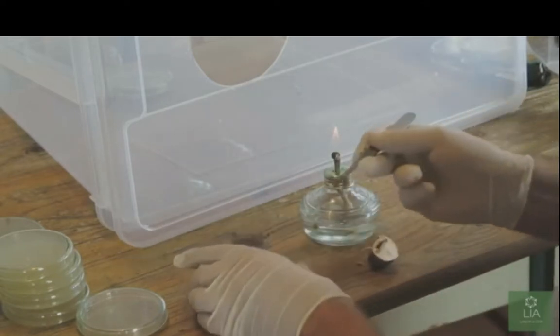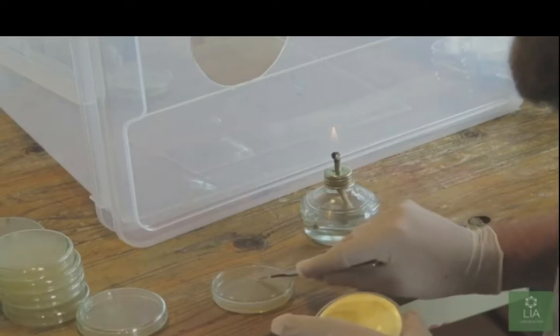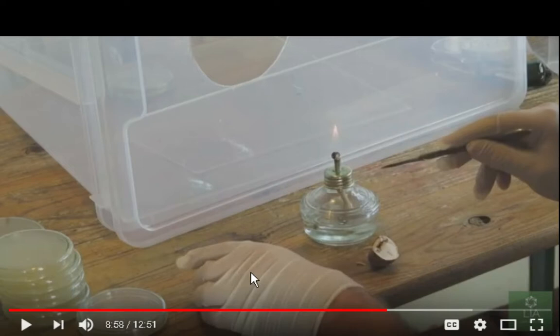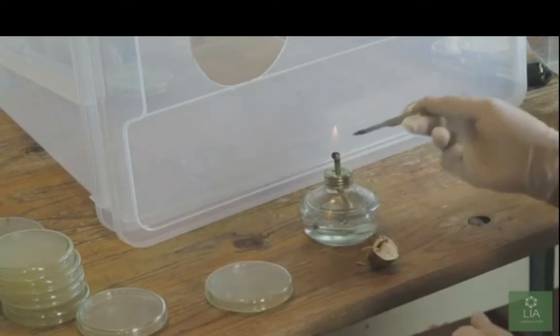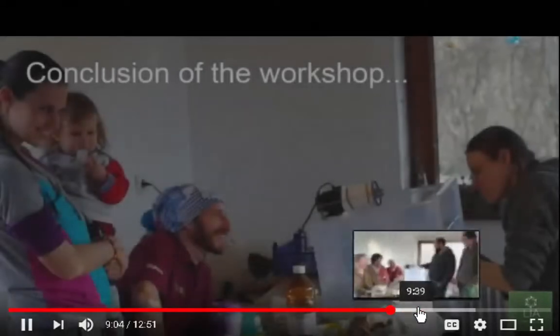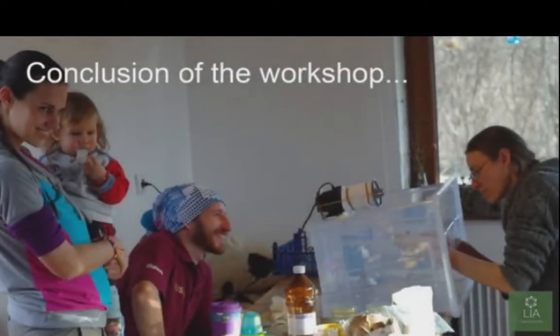alive. Okay, that's a good idea too. Yeah, so there are some good ideas going on. I was just thinking, so just tap that onto the tissue. Okay, I used one dish to do the whole thing, but I don't see a problem with doing that. And that's it. Sterilize and do the next one. He's got 3 different pieces there. Now it's the conclusion of the workshop.